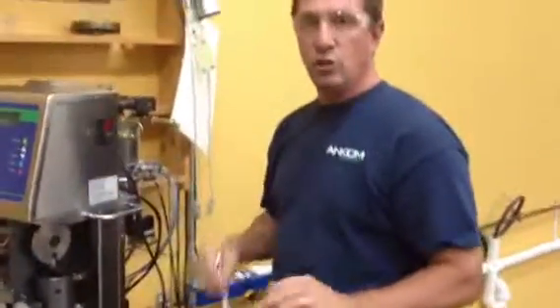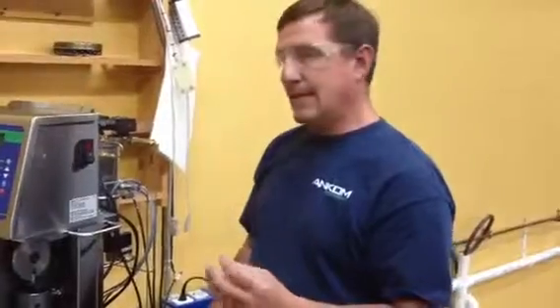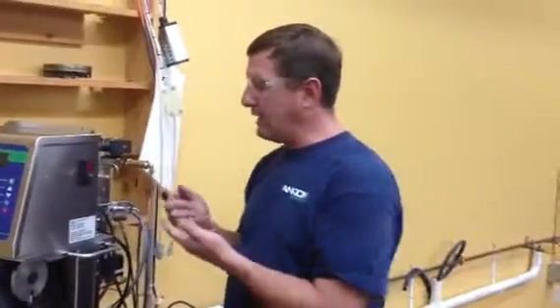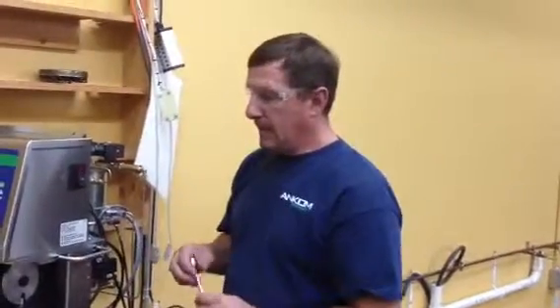In your situation, you have such a small leak, it's only losing a little bit of ether each run. Now, what that indicates to me is it's not a severe leak. If it was, you would be getting ETS, electronic temperature switch, faults. And you indicated that you're not getting any faults. So I think the best way to determine if you have a possible leak somewhere is an actual residue built up on one of the valves.